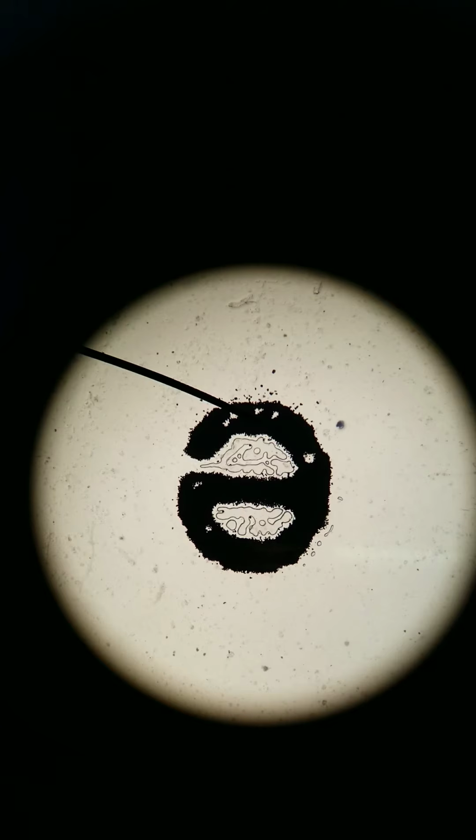There's our letter E. When I placed the slide of the letter E on the stage, it was facing me, so it looks like the letter E correctly. Here we can see that it's rotated 180 degrees. It's inverted. The reason why it's inverted is because the ocular lens, the curve of it, basically flips the image, without getting too much into the physics of it. The ocular lens is flipping the image, so that's why it appears backwards to us.